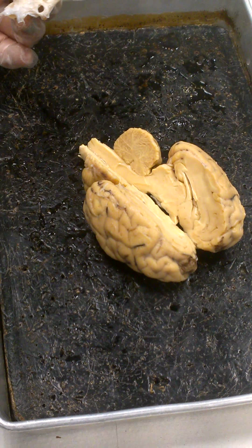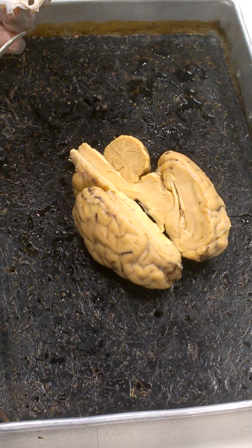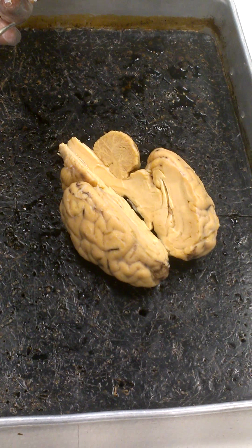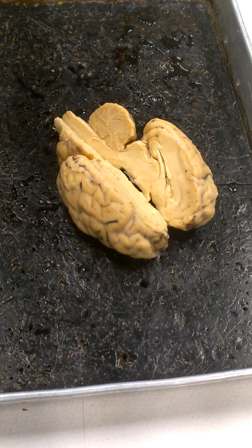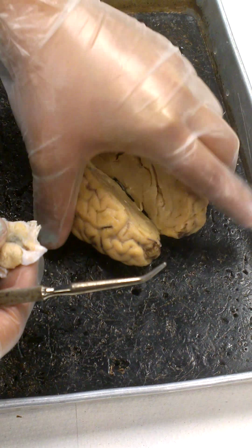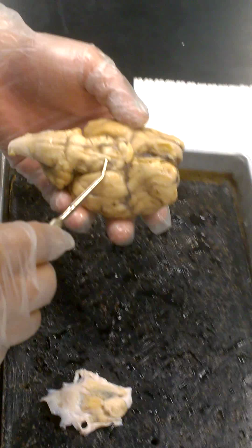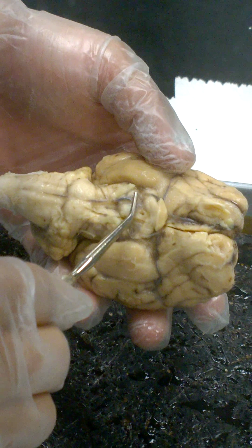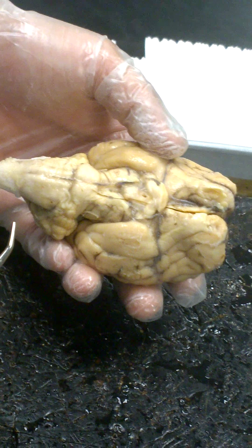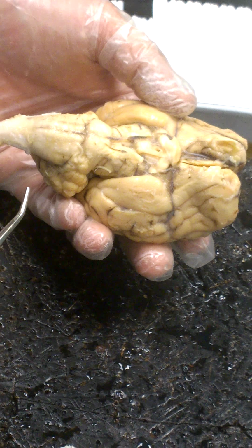If you haven't done that already, you'll need to do that. But actually you'll need to be very careful, because we'll talk about cranial nerves in a way that you remove this membrane to preserve any small white fibers. You can possibly see on this brain, for example, right here, are two small cranial nerves. This happens to be cranial nerve pair number 6, the abducens nerve, and you can see that this is anchored to this membrane. There'll be actually several pairs of nerves that are anchored to the membrane, so you have to locate those first and be very careful to clip them away from the membrane before you remove it, so that you don't remove the nerves at the same time. They're small and they're fragile.